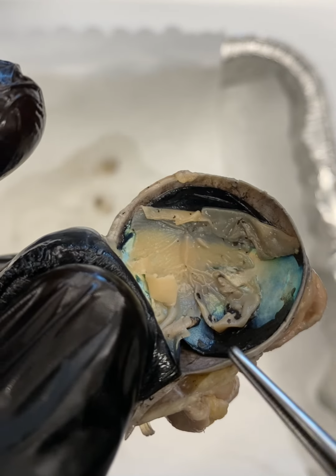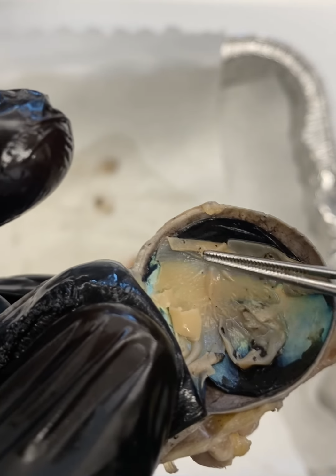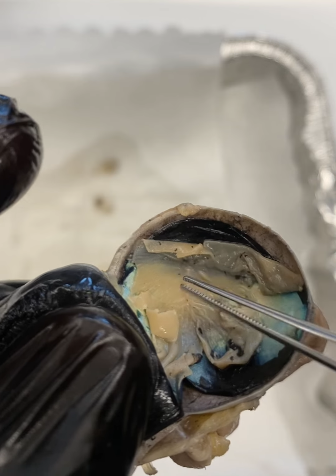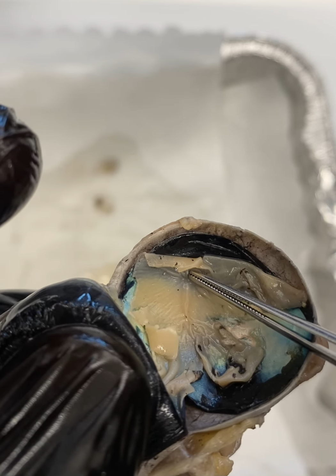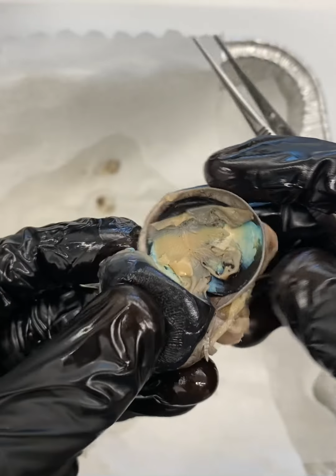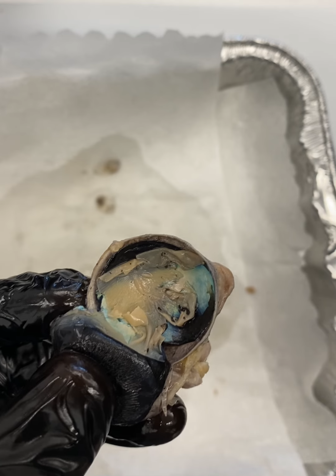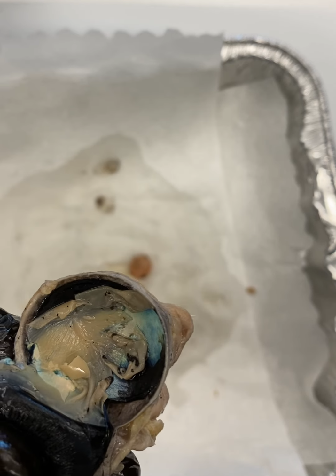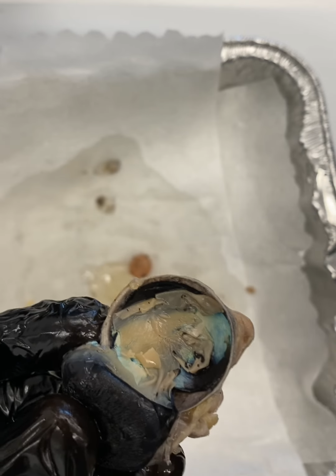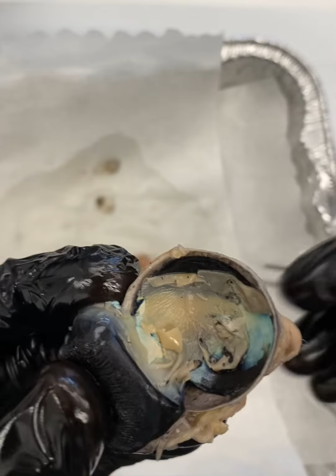Now you can see here, in this image, it looks like at the tip of my probe all this retina is radiating to one single point. This is something called the optic disc, and we alluded to it in the first video. We said the optic disc is essentially where the retina is leaving the eye, or you can think of it as where the optic nerve is entering the eye, and information is being carried back out through the optic nerve.